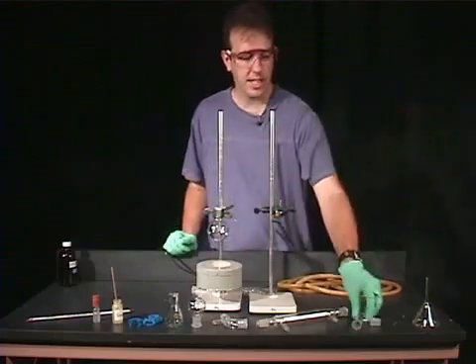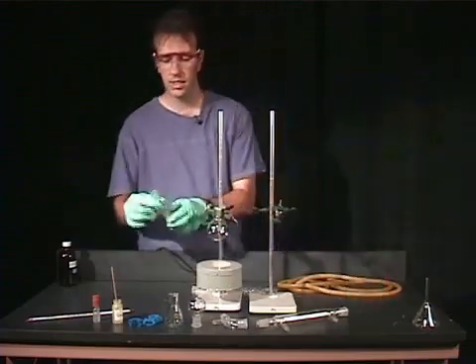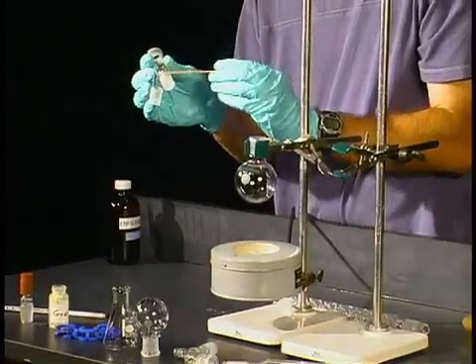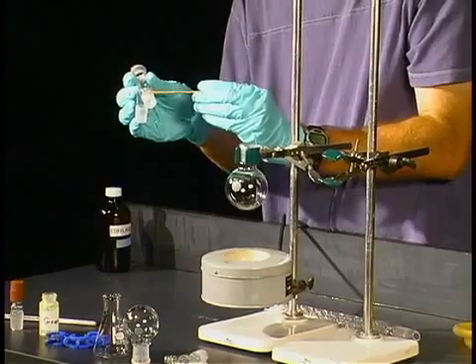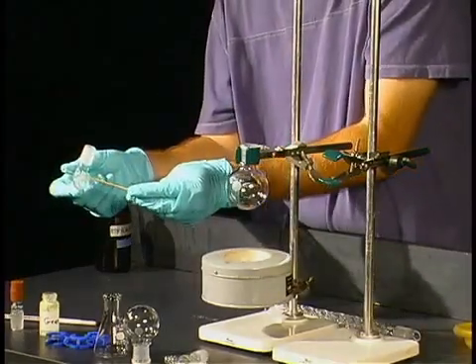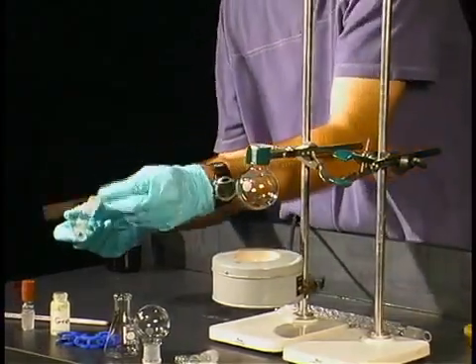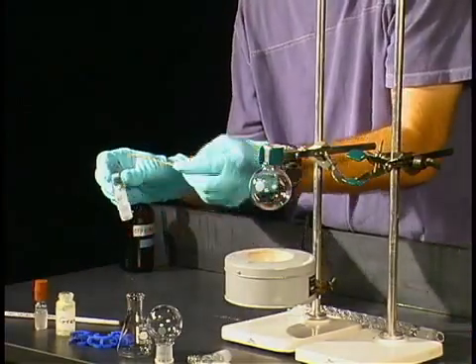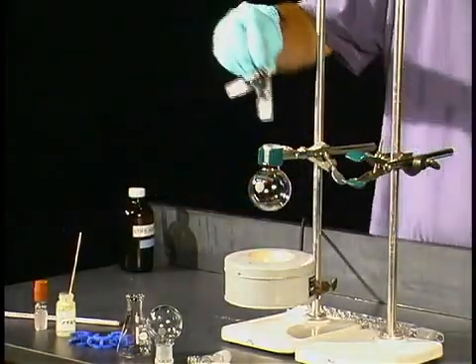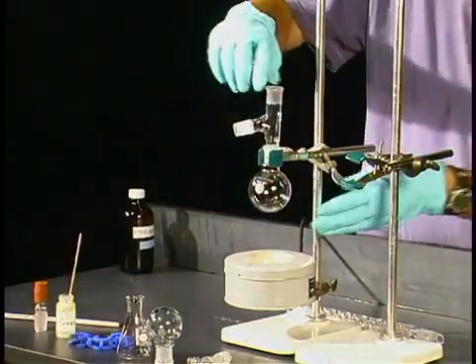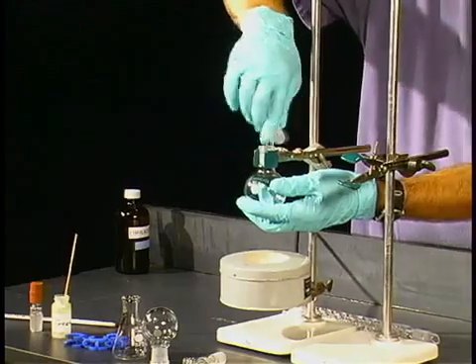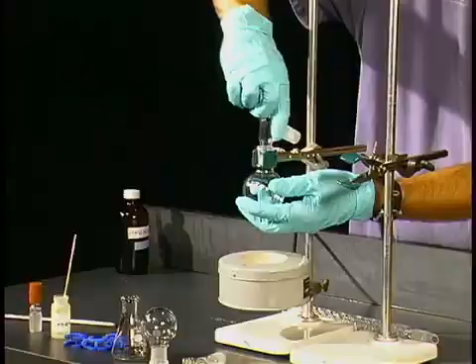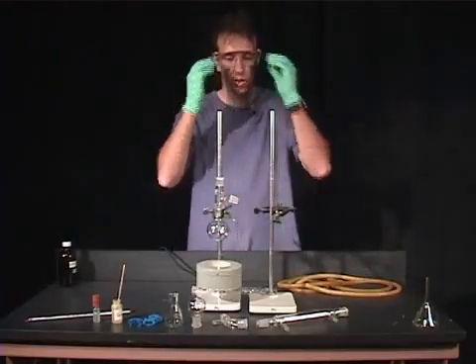So I'm going to take the next piece of glassware, which is our sidearm adapter. I'm going to take one of these applicator sticks that has grease on it and add a little bit of grease at two points on the joint, 180 degrees apart. You don't need a whole lot. And you want to put it as high on the joint as possible because you don't want this grease getting into your solvent. Usually you're going to rotate this once or twice, and you'll start to see the grease spread out.